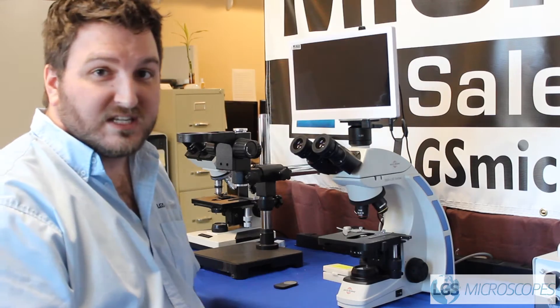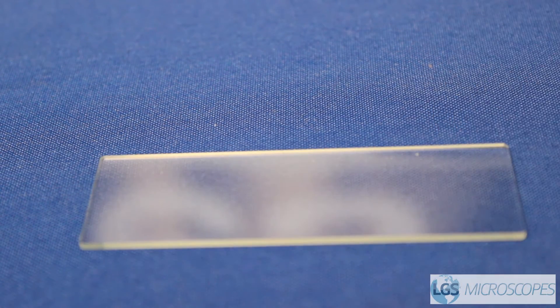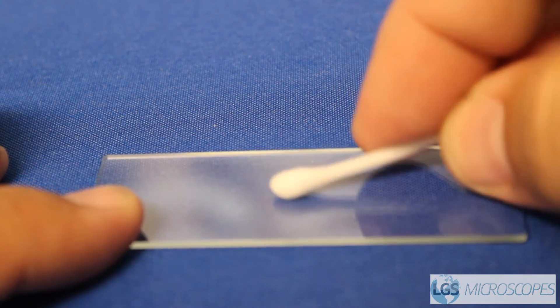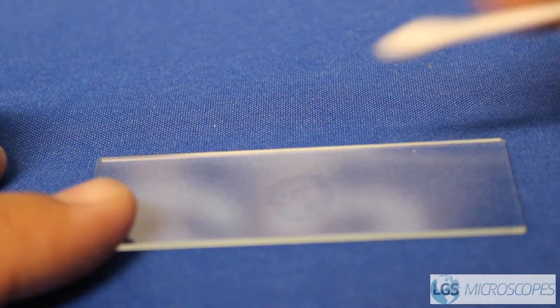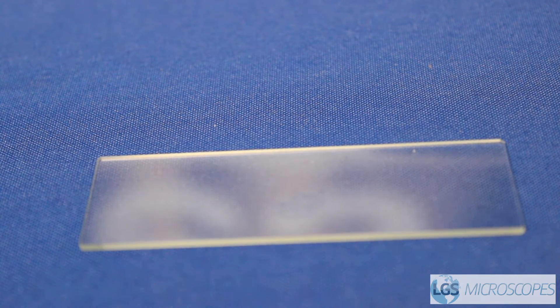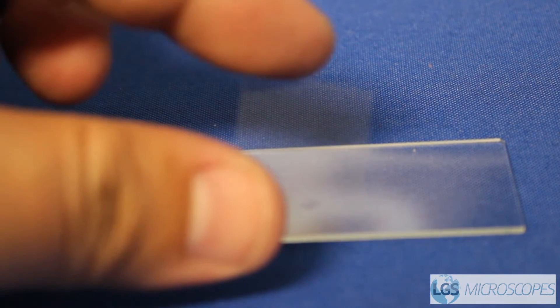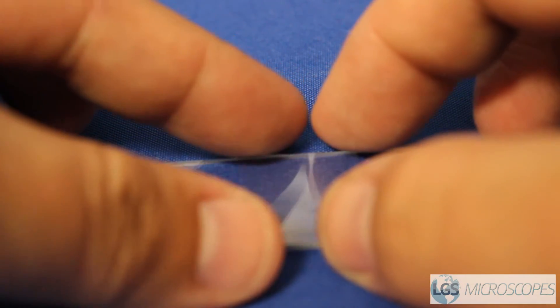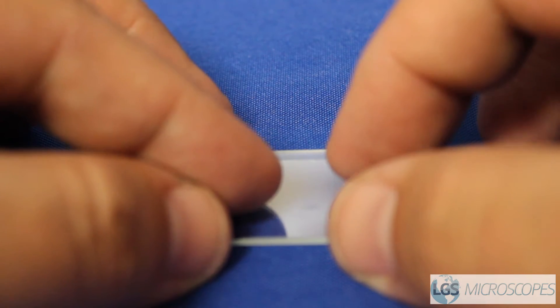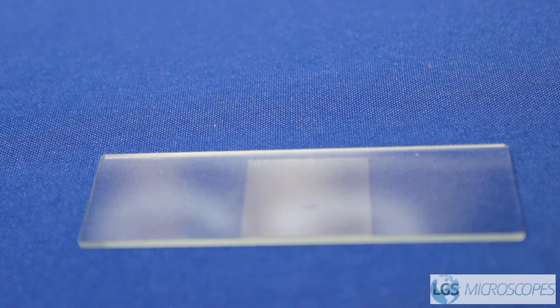This microscope also has a camera, so we're going to go ahead and turn that on. Of course you need to get your slide. When you're preparing your slide you're going to need your slide, whatever your sample is, and then a very important part — if you're going to use immersion oil, you need to use a cover slip. You just place that right over. This is so that you don't get any stain or any of your sample onto the objective lenses.